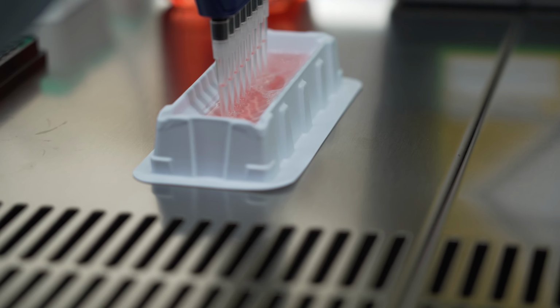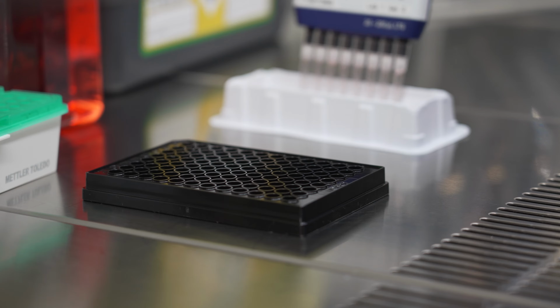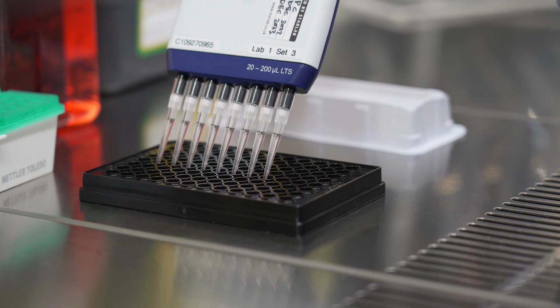The basis of calcium imaging is when neurons fire an action potential to electrically signal to one another, voltage-gated calcium ion channels open and calcium ions flood into the cell. And you can use proteins that fluoresce in the presence of calcium ions as an indirect measure of the action potential and electrical activity.